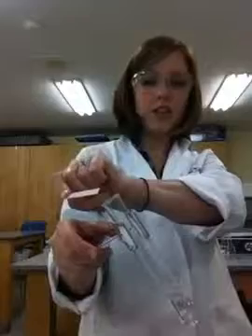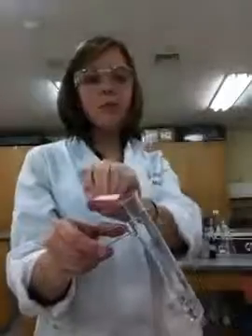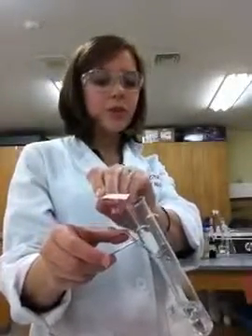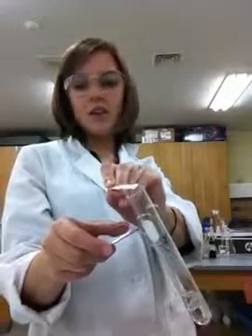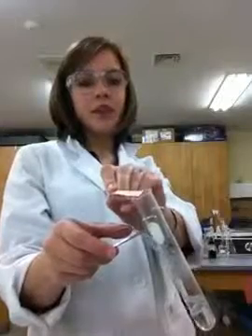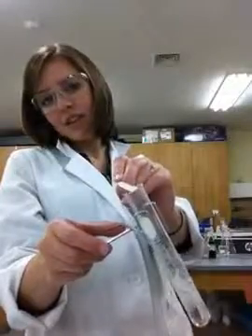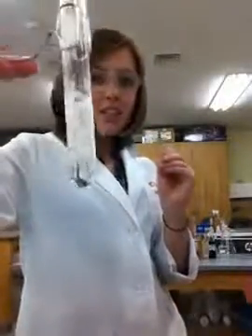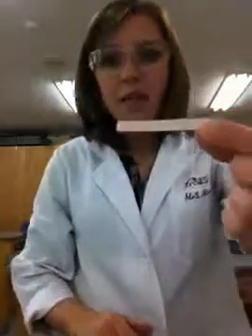So here, watching this reaction I'm going to go ahead and hold over my red litmus paper. Remember, red litmus paper turns blue in the presence of a base, and in this case, it should be the gas ammonia that is produced. Oh, starting to bubble, I see gas coming, and I'm going to remove it from the heat. Remove it from the heat before it boils over, and look, go ahead and turn off this heat. We have a very distinct blue color.